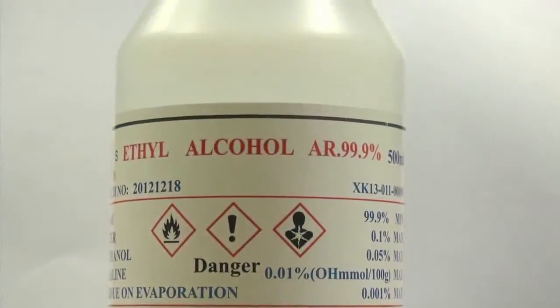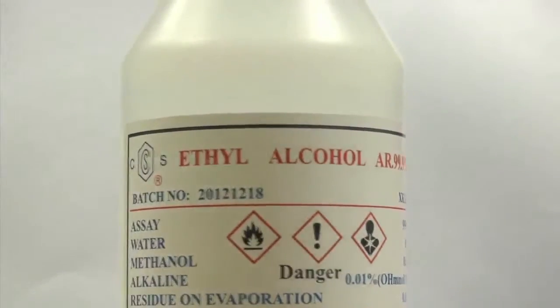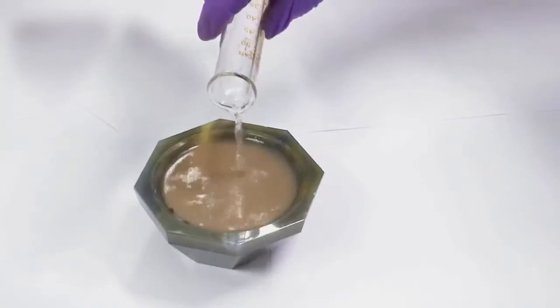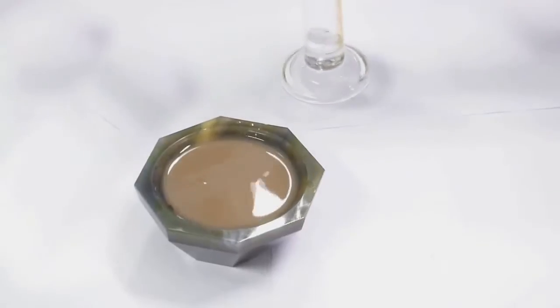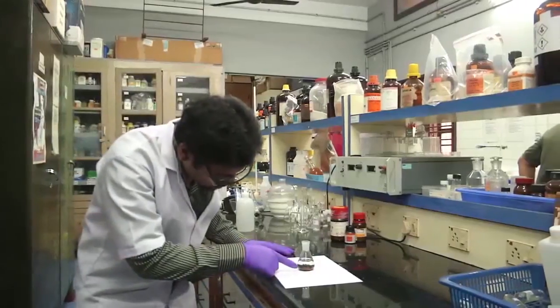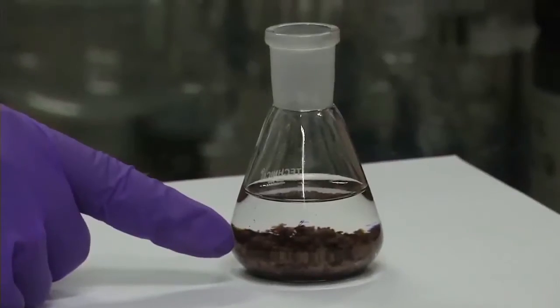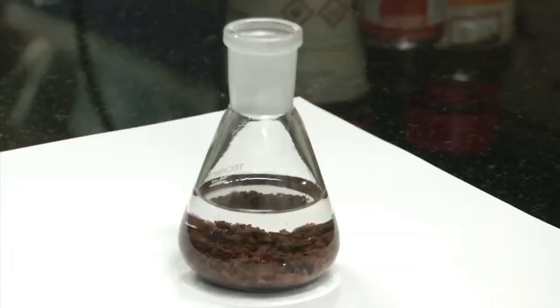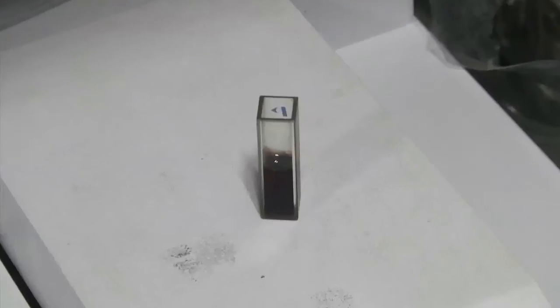Soluble impurities can be removed by the addition of ethyl alcohol in which the clusters are insoluble. As you can see, the clusters are insoluble in ethyl alcohol. In the case of this ligand, the clusters are soluble in water.